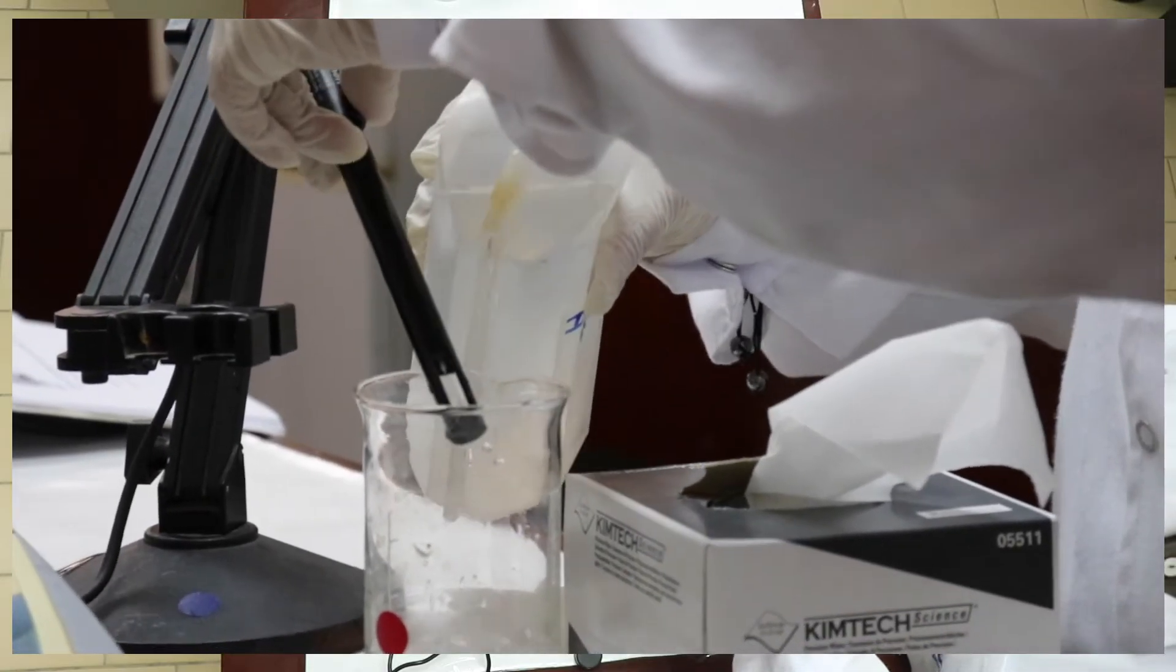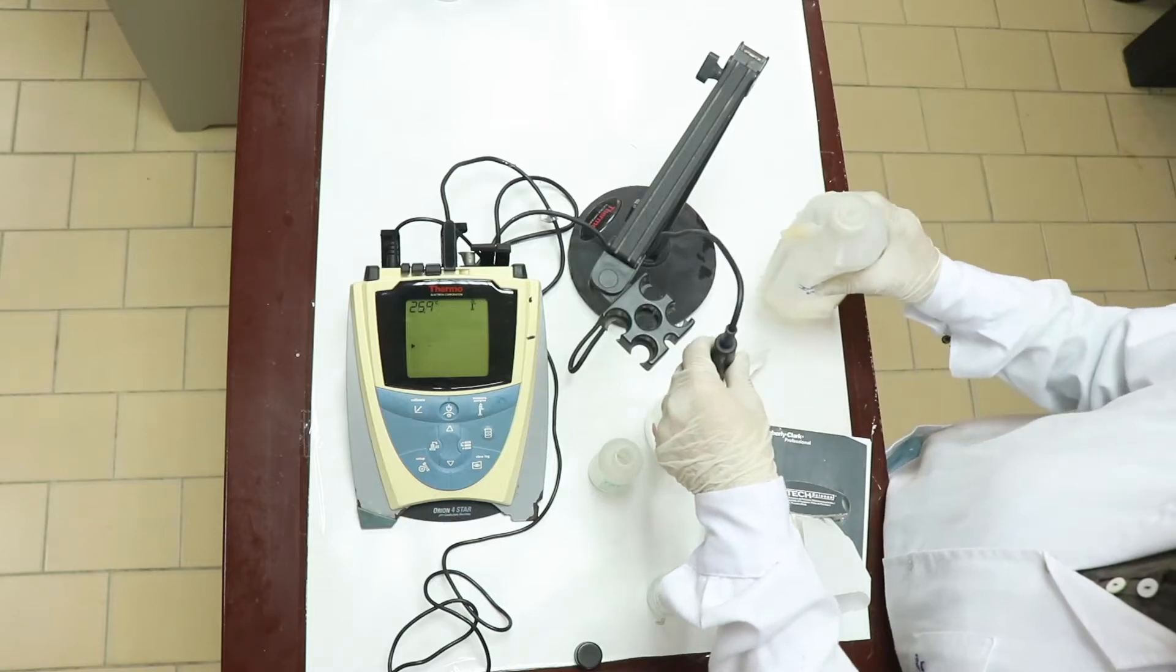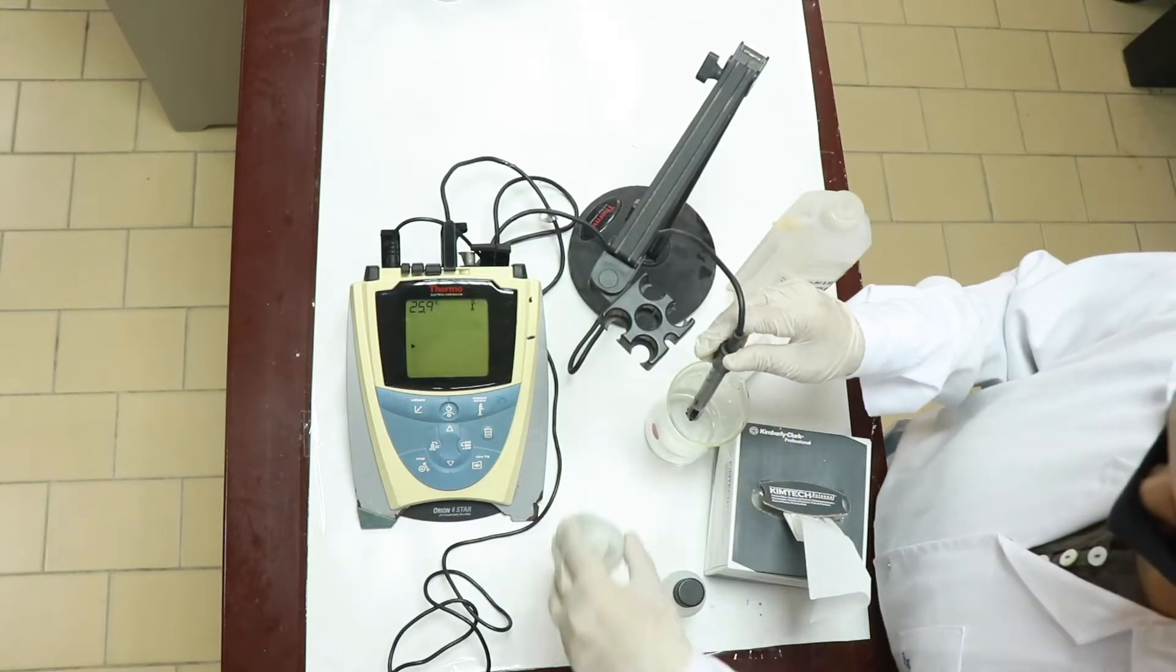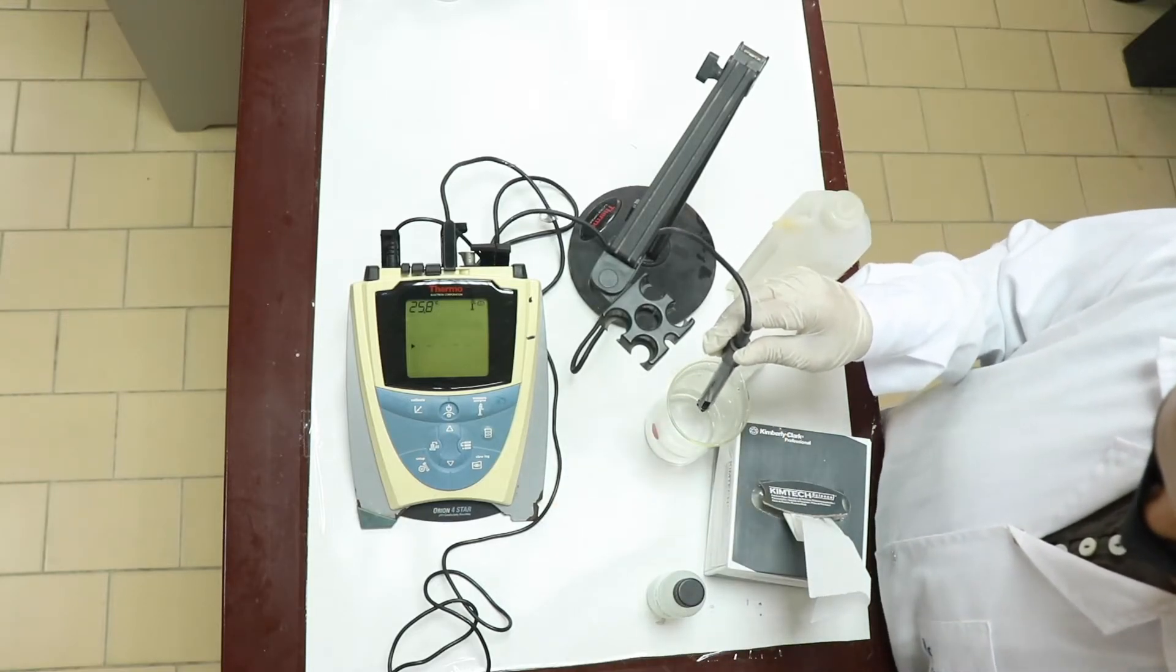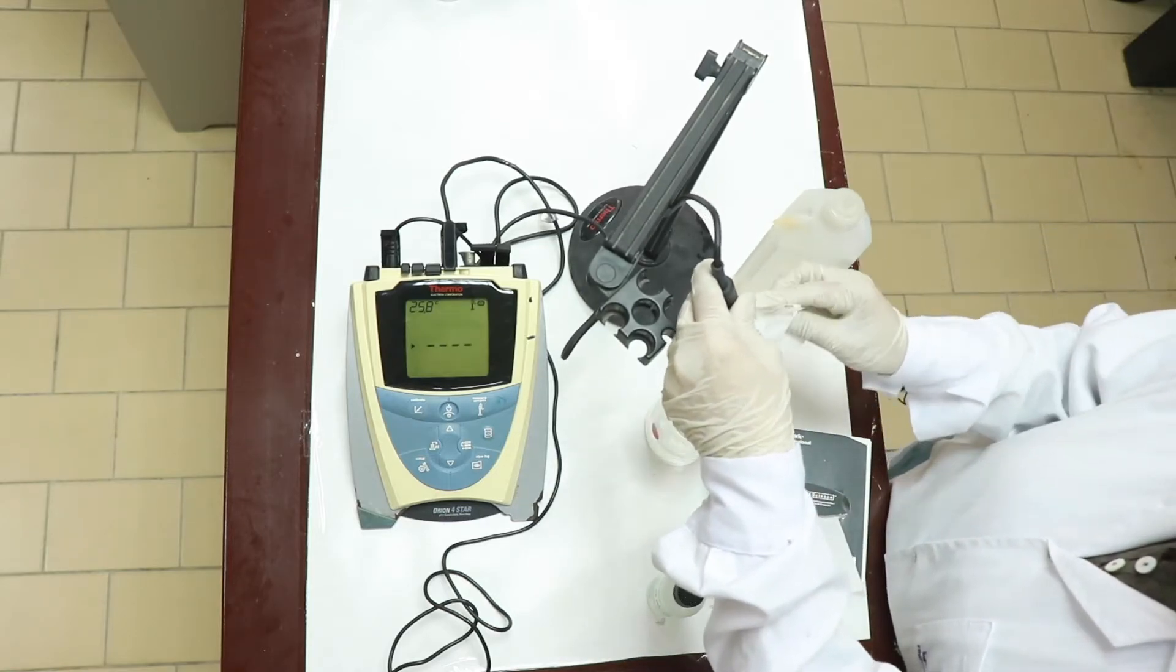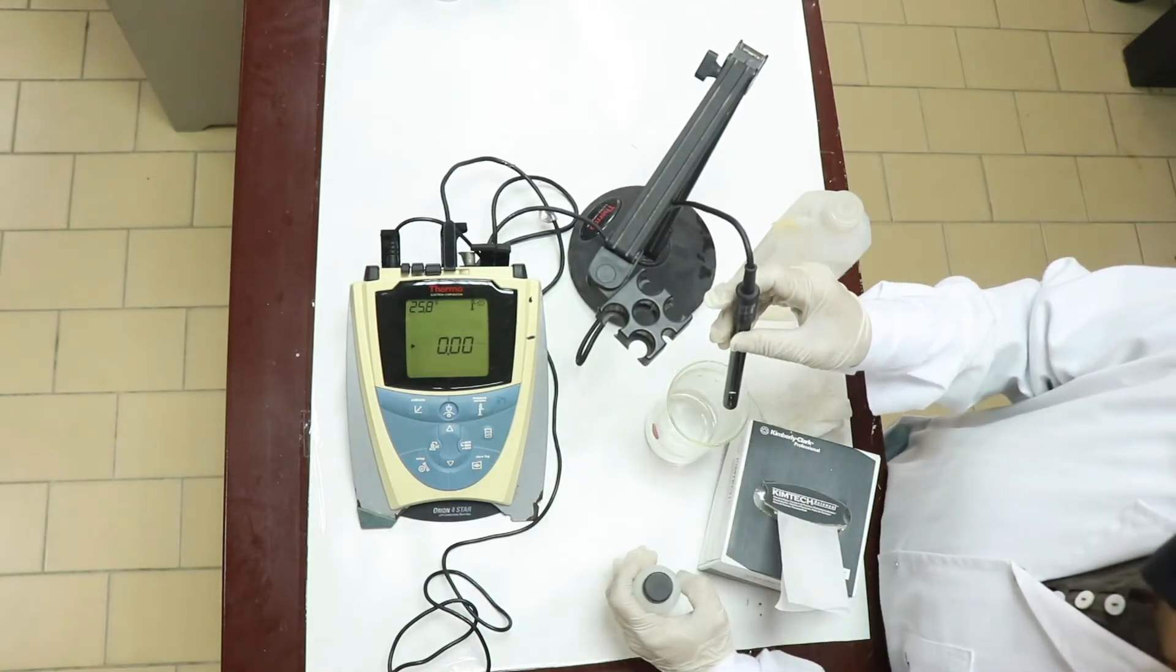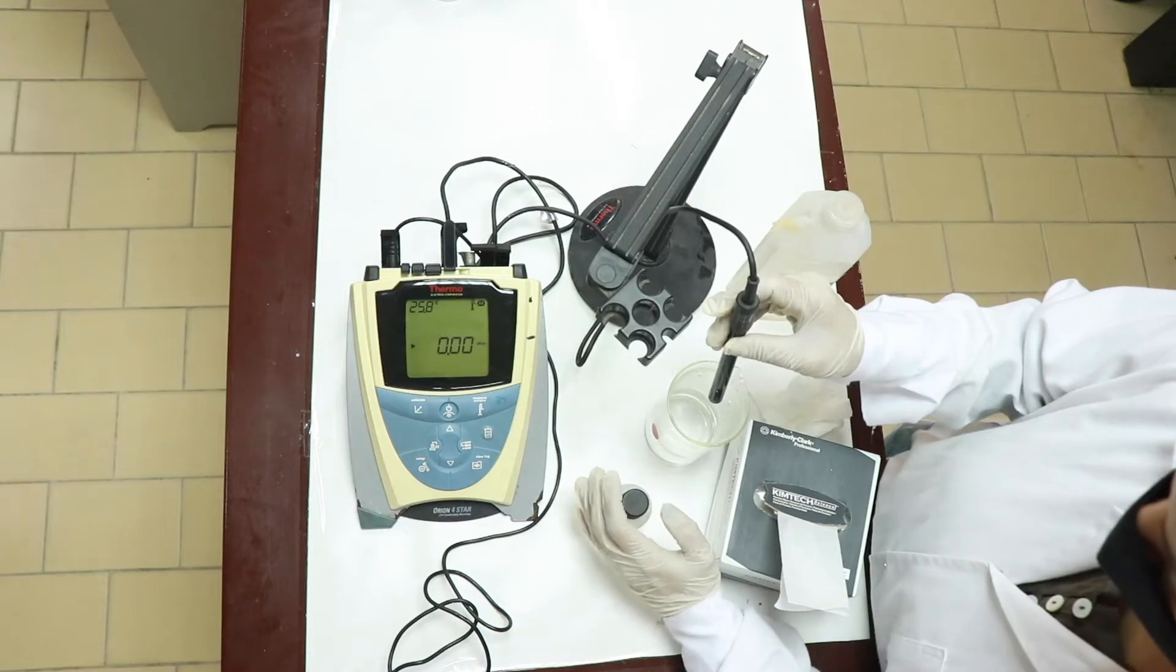You have to wash the electrode again. Remove the solution. Again, wipe it well.